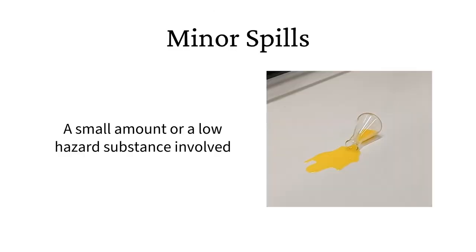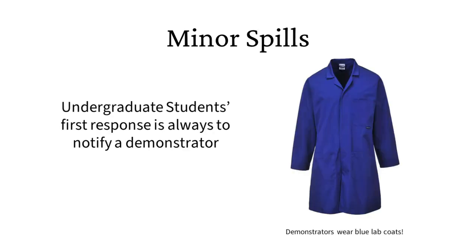A minor spill is where the risk is minimal, from only a small amount or a low hazard substance being involved. Minor spills can normally be dealt with quickly and easily without the need to call the emergency services. If you are an undergraduate student in a teaching lab, your first action should always be to call a demonstrator or technician and make sure that nobody gets close to the spill.